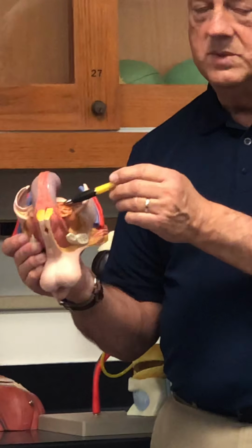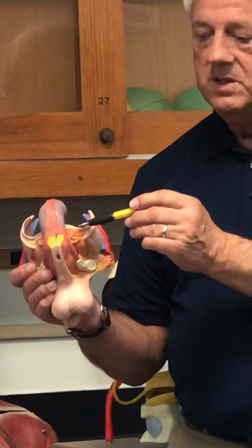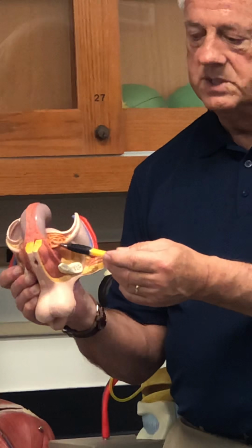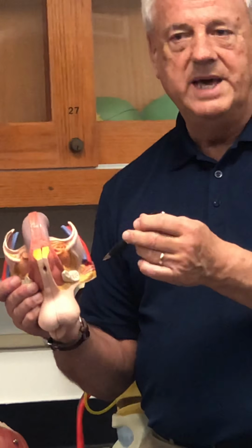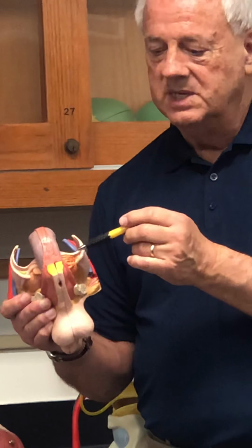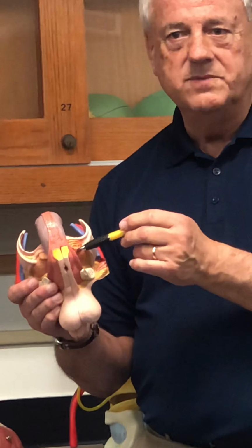This is where we've got reservoirs of sperm that actually make their way in here, okay? Notice it's associated with this structure. What's this structure called? Seminal vesicle, right? Remember that we have to add fluid to the sperm, right? Once we start the ejaculation process, the sperm comes floating out and it mixes with this fluid that comes in from the seminal vesicle.